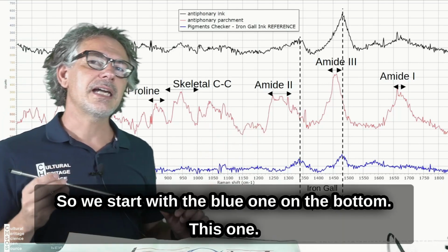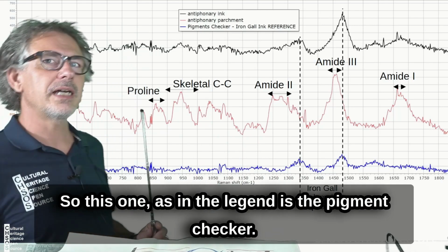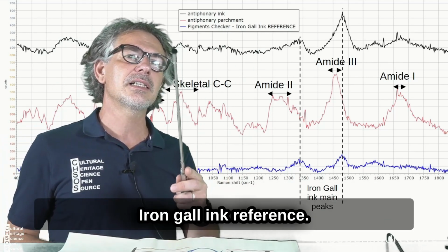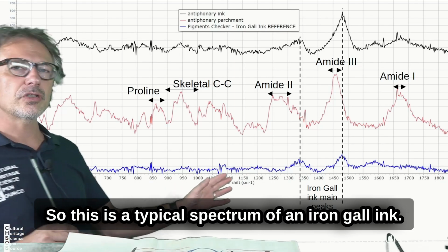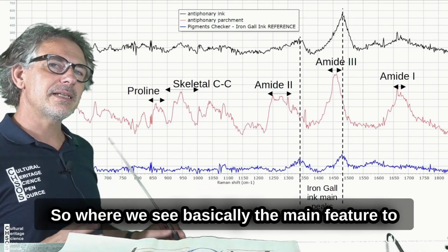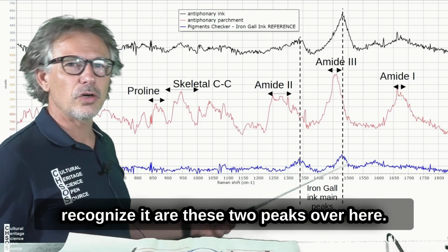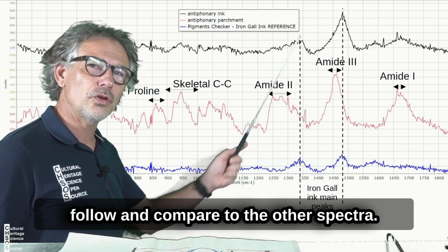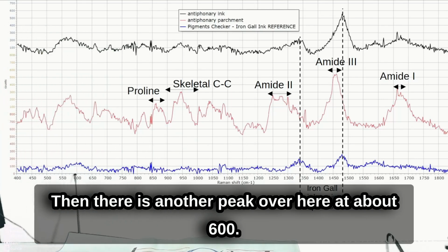Okay, so we start with the blue one on the bottom, this one. As in the legend, this is the pigment checker iron gall ink reference. So this is a typical spectrum of an iron gall ink, where the main features to recognize it are these two peaks over here, this one and this one. I put also this line to follow and compare to the other spectra. Then there is another peak over here at about 600.